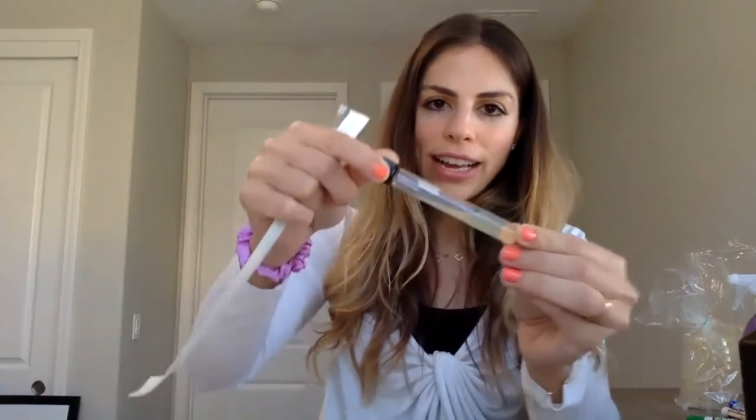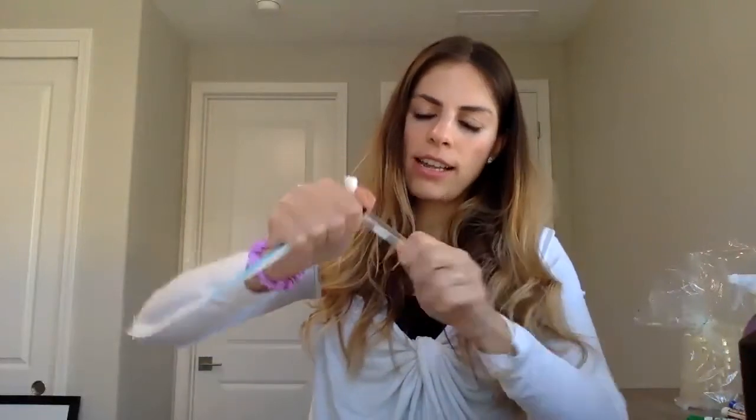So the way we're going to do this experiment is I want you to use a new inoculating loop for every single plate and start with the plate that has no salt to the highest salt concentration. So this is what I'm going to do. I'm going to hold your slant so that it's slanted, hold it like that, and then open it. I've already opened my inoculating loop at the stick side. Remember, don't touch the loop because this is where we want to pick up the bacteria.